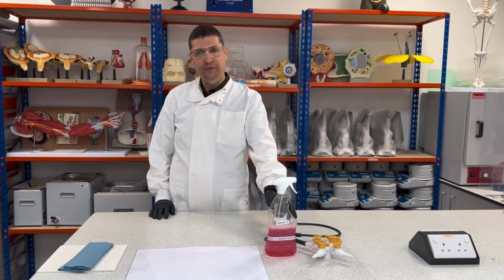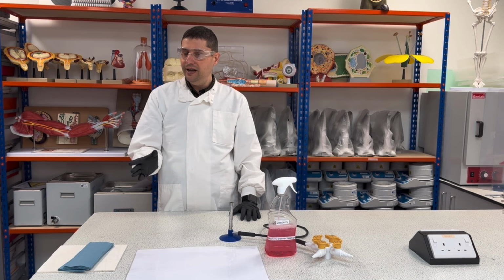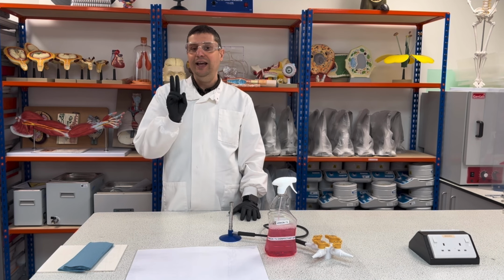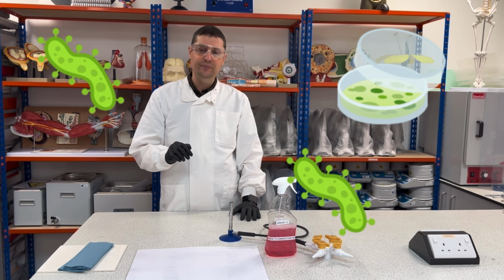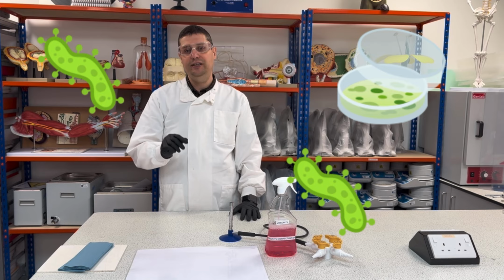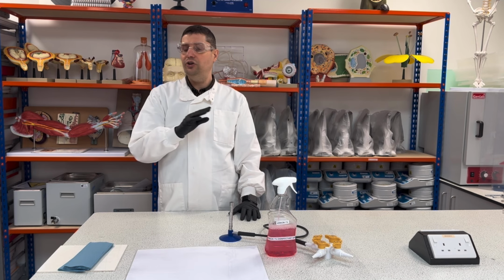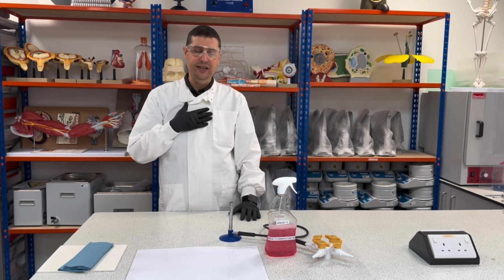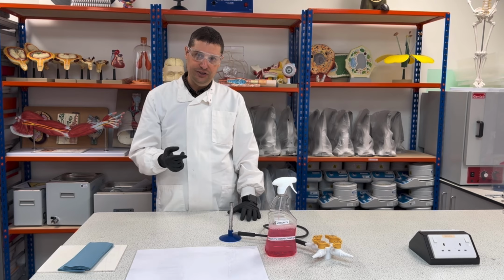I will be dealing with flame, so something can go wrong every time I'm dealing with flame. And second, because I'm using bacteria, even if the bacteria I'm using are in small amounts, in a small population, and not cause any harm for me, if it goes in my eyes, it can cause an eye infection.